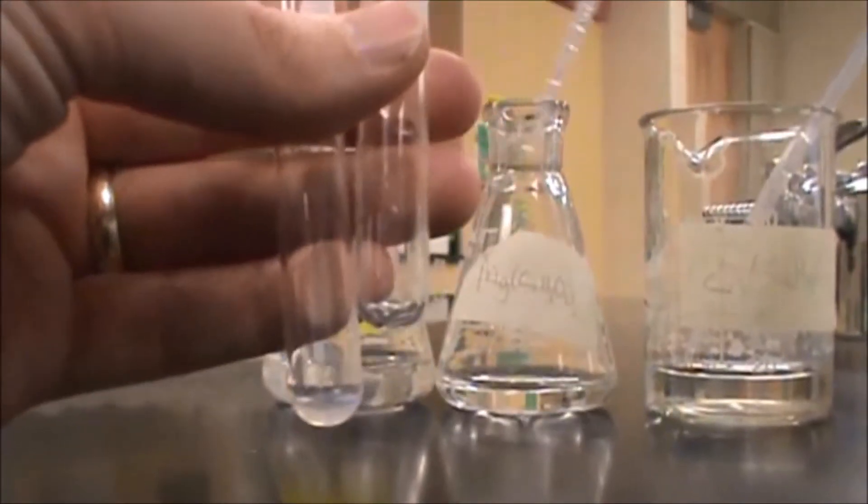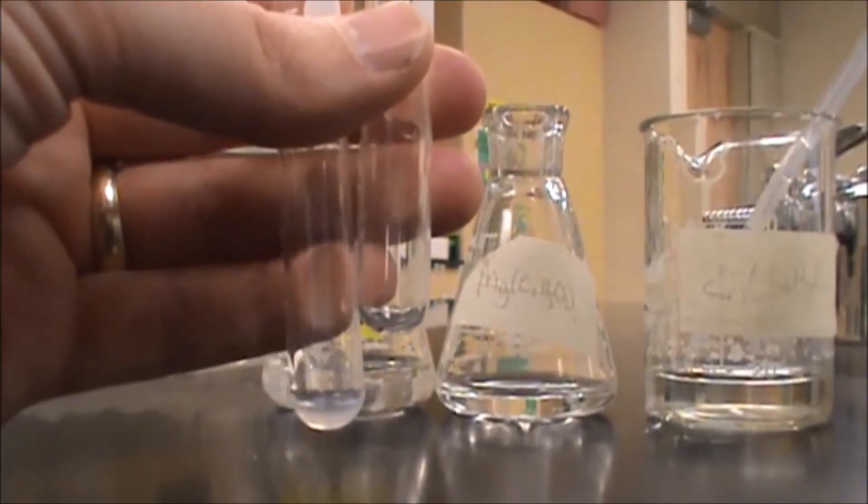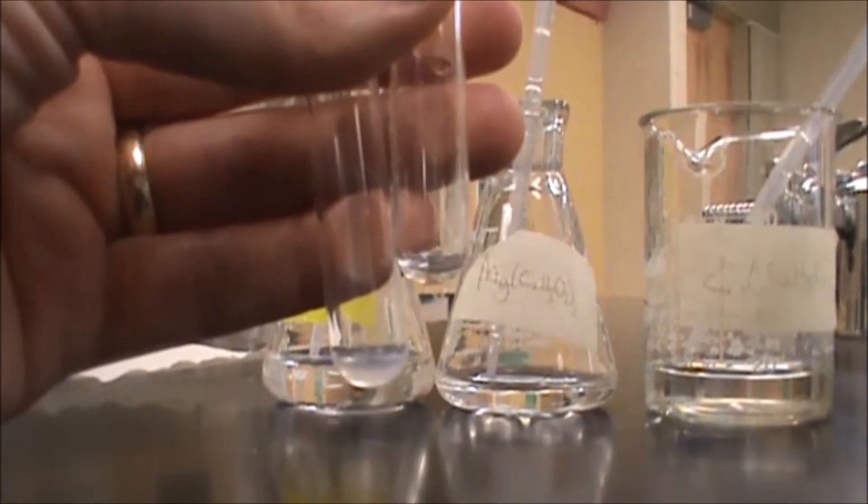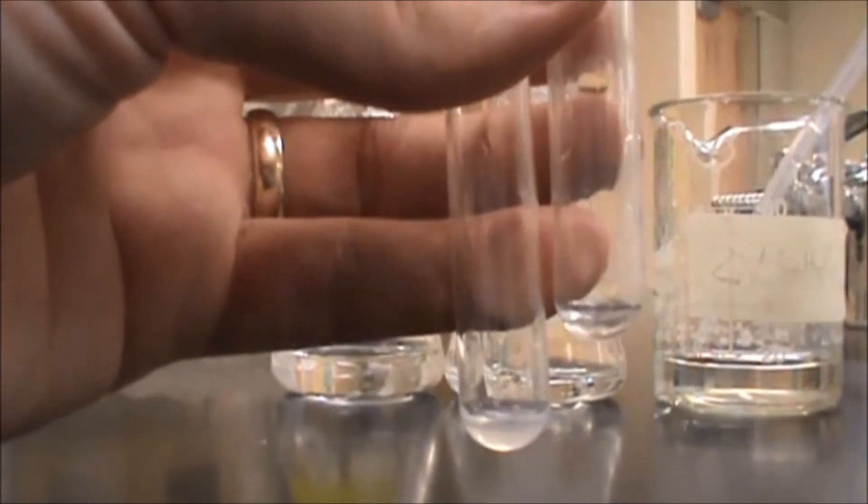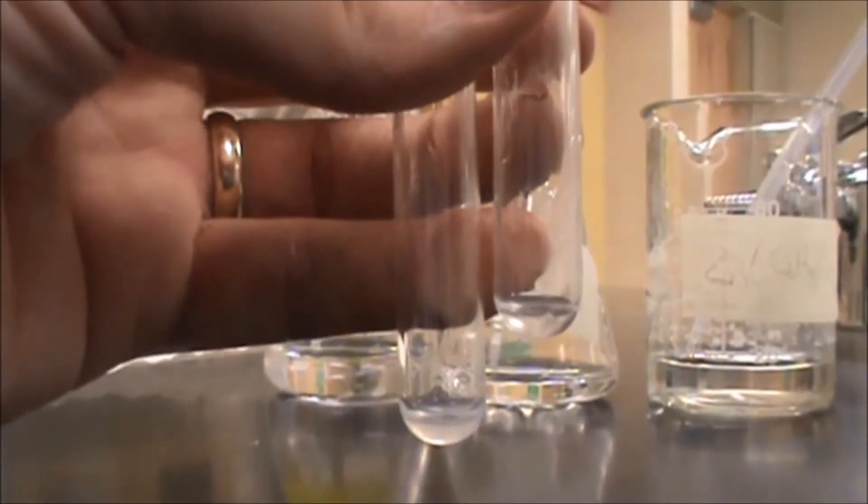And we are going to do the same thing with magnesium, we are going to take a drop of magnesium, you don't want any more, and then we are going to add sodium hydroxide to that as well. So when we get the sodium hydroxide in here, that's going to precipitate as well.